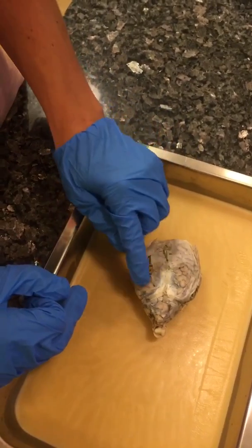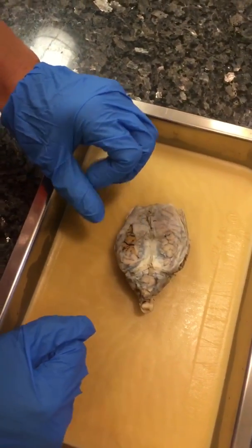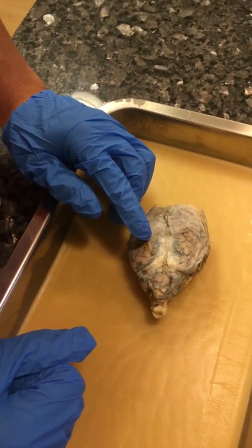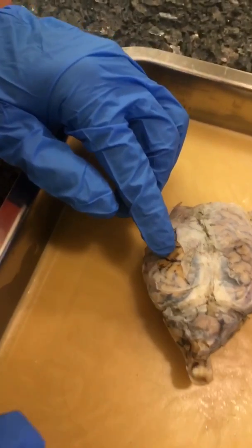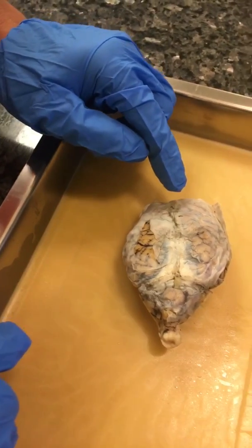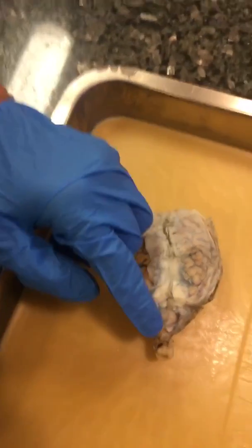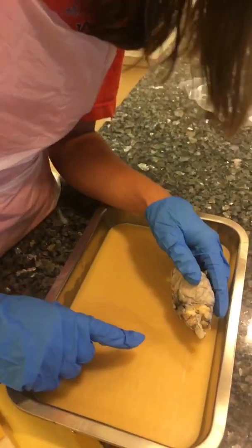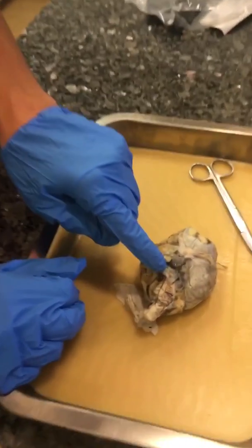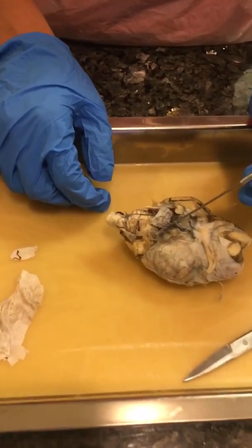So this big area is the cerebrum. We also have the gyrus, which is the white part right here, and the sulcus, which is the darker part. Here we have the longitudinal cerebral fissure, and here we have the brain stem, and here we have the midbrain, and here we have the cerebral peduncle.